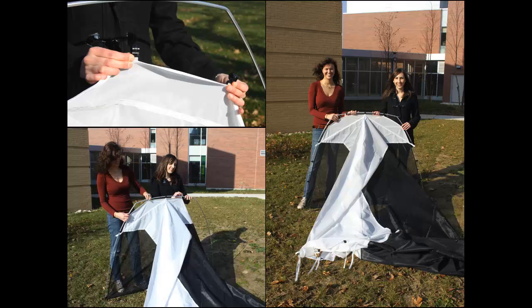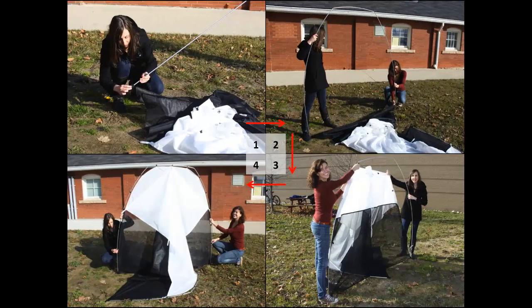There is a series of black snaps that run along the edge of the trap material. With the pole arched and secured in the base pockets, proceed to secure these black snaps along the length of the arched pole frame. Moving on to the front end of the trap, repeat the same steps just described to now secure the long pole to the trap.